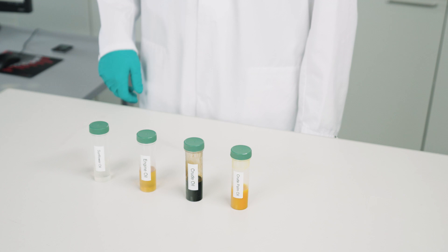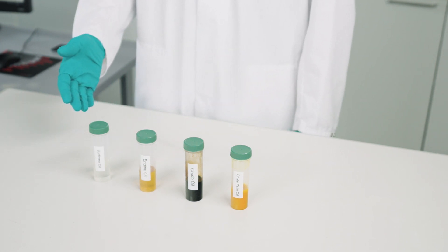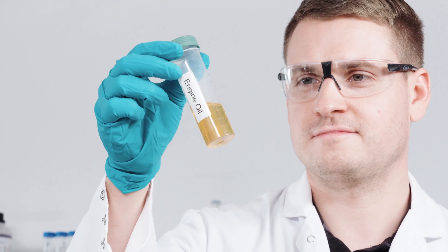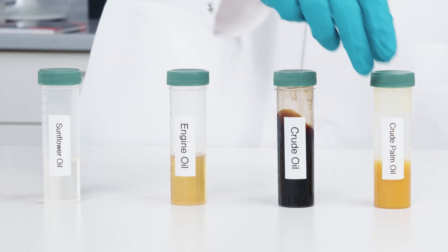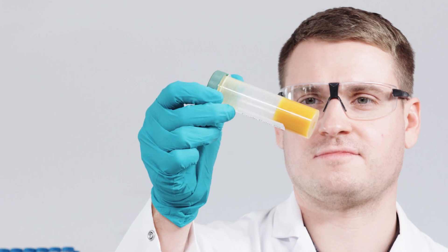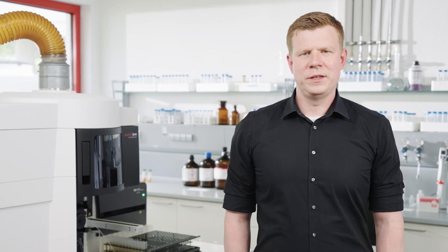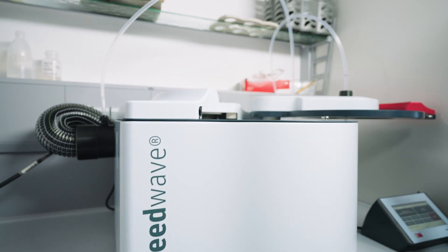Oils have different viscosities and crystallization states due to their different fatty acid contents. Mineral oils, but also some edible oils such as rapeseed oil, are liquid at room temperature. Palm oil is solid at room temperature. Due to the high viscosity and the partial crystallinity of the samples, a direct measurement of the unprepared raw materials is not possible.